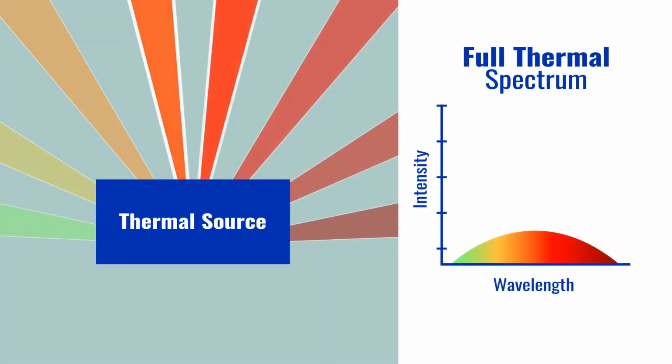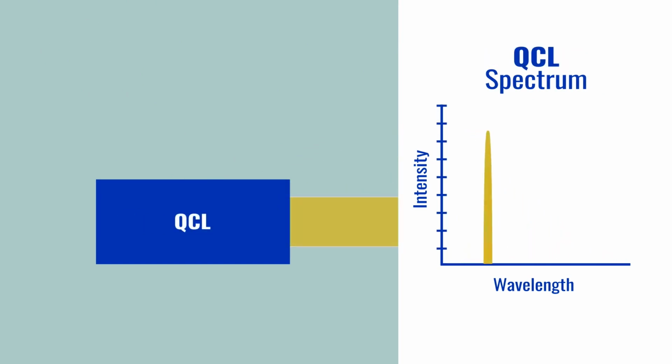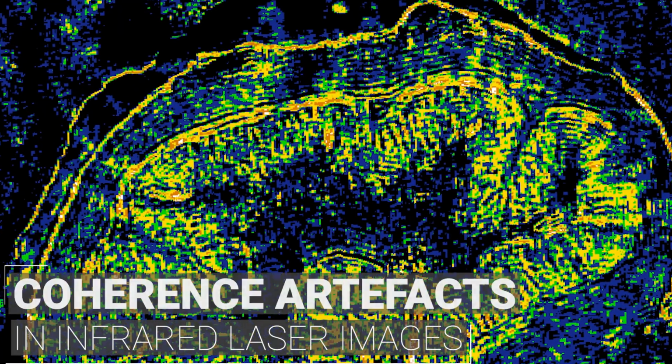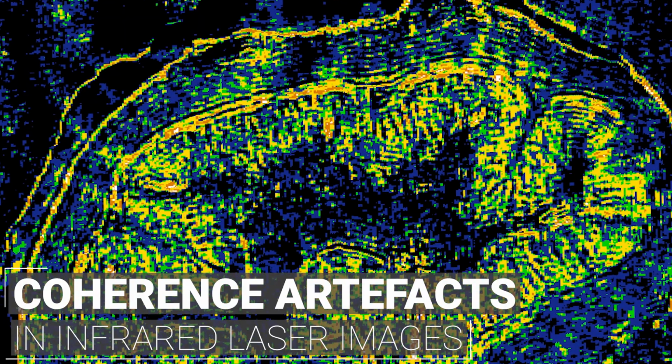As FTIR imaging uses a broadband thermal emitter with low spectral power density and incoherent emission, you never have to worry about coherence artifacts. Infrared laser imaging by QCL, on the other hand, offers a very narrow line with the high spectral power density and, most important, coherent emission. We will see some coherence effects and artifacts around the structures and this will disturb the whole image.